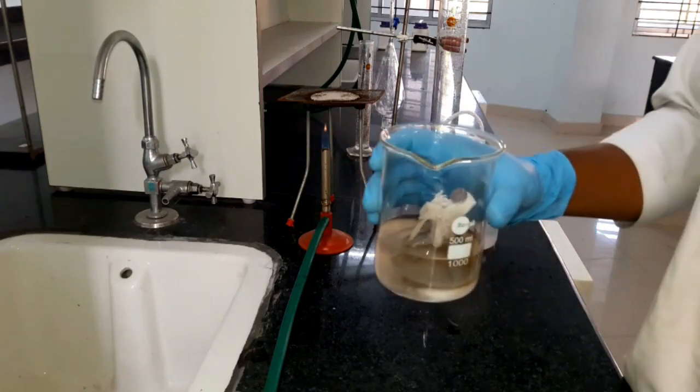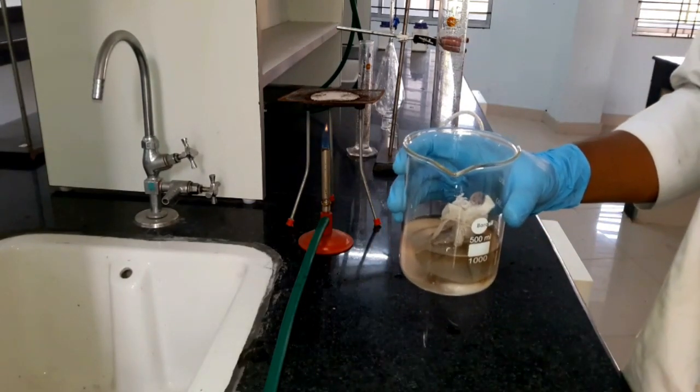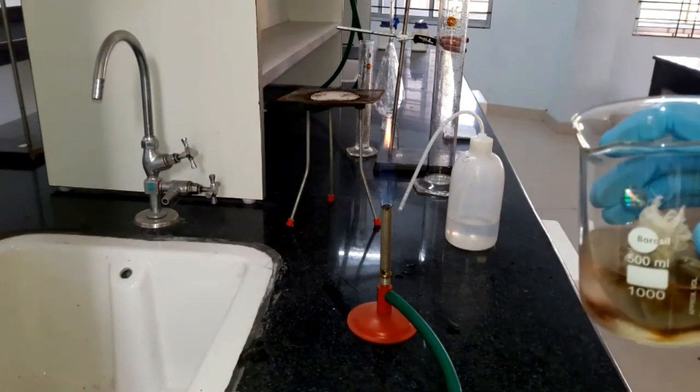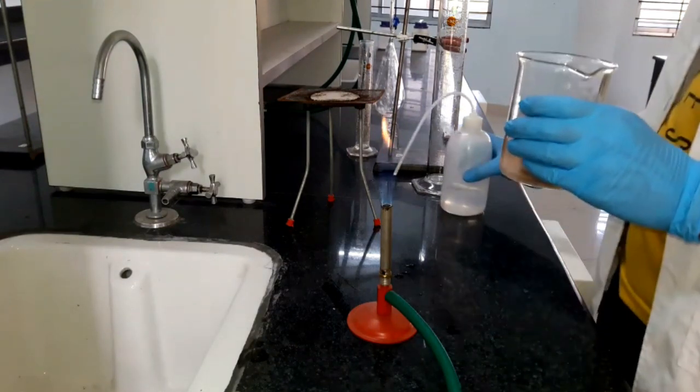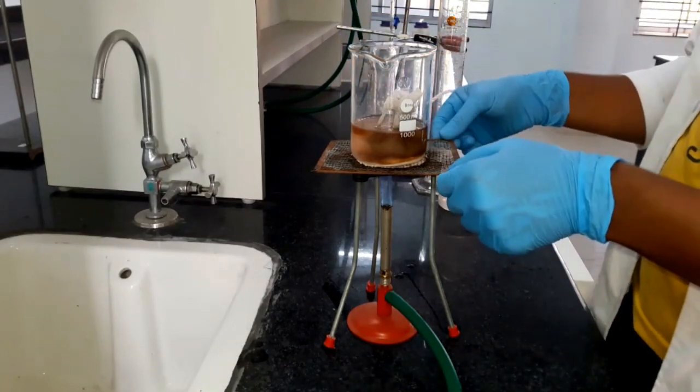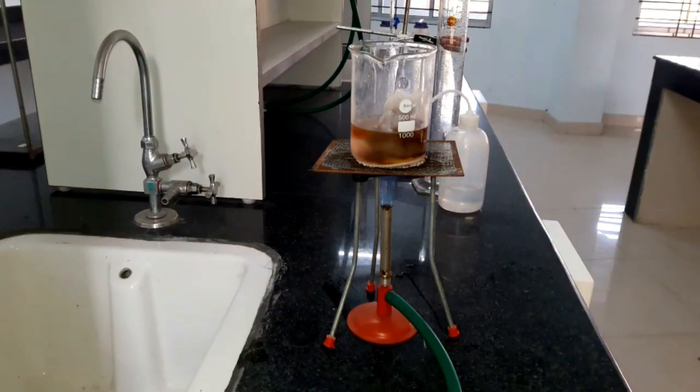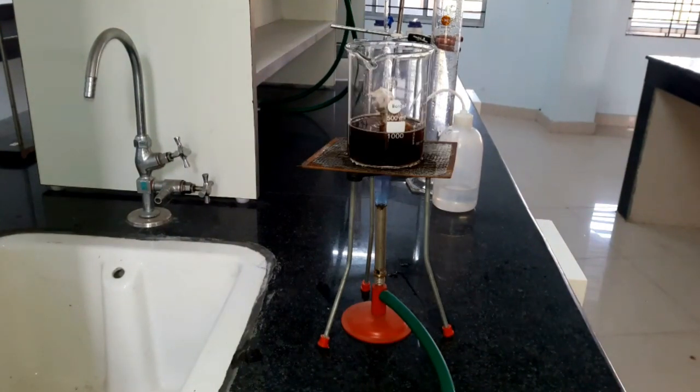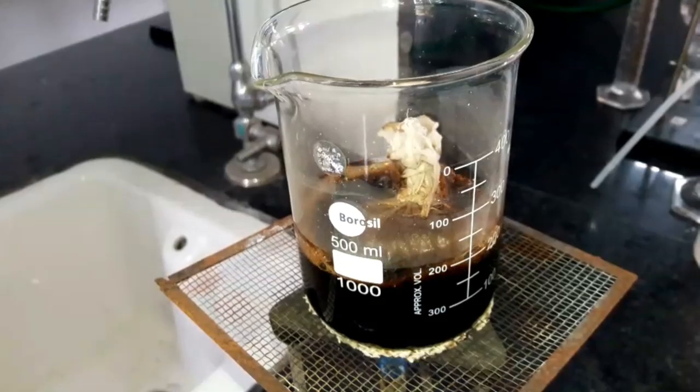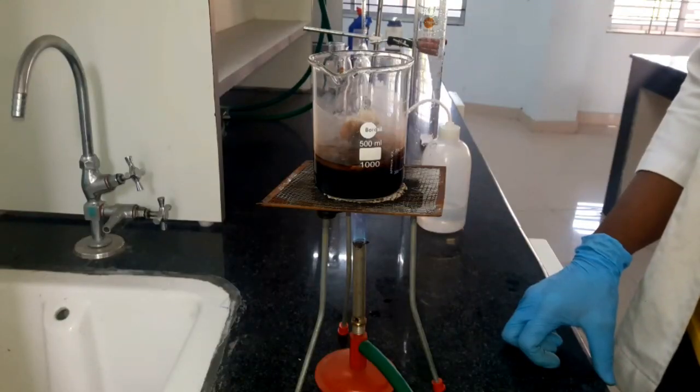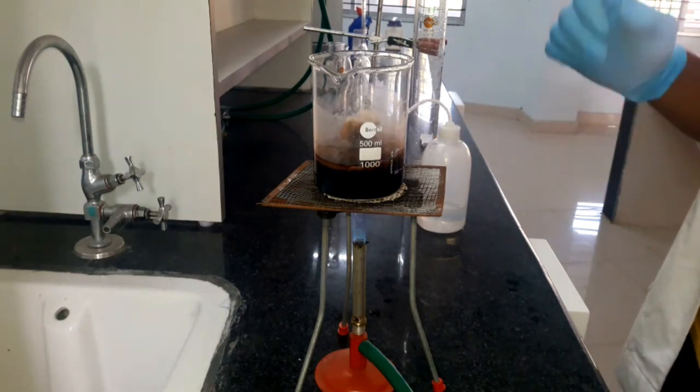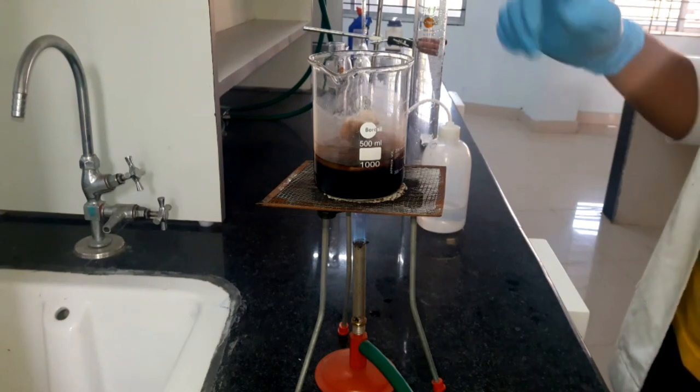Water is allowed to boil for about 20 minutes. Here boiling is going on. After 20 minutes we stop heating when we observe dark brown coloration. This mixture is allowed to cool to room temperature.